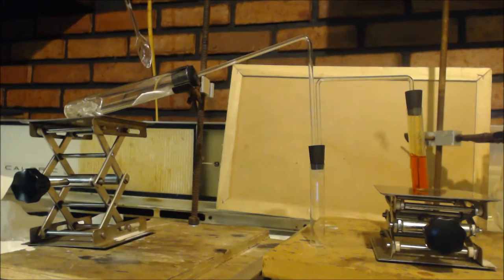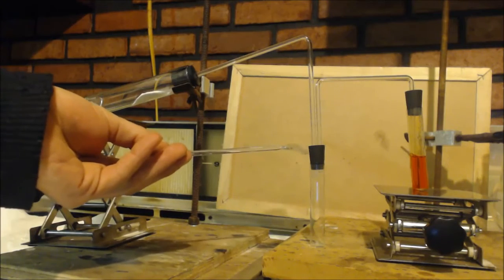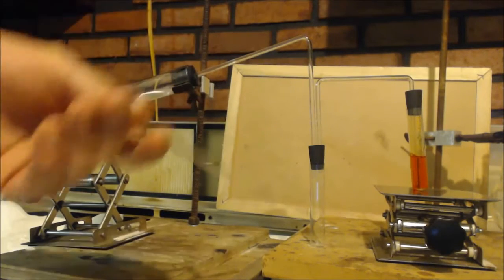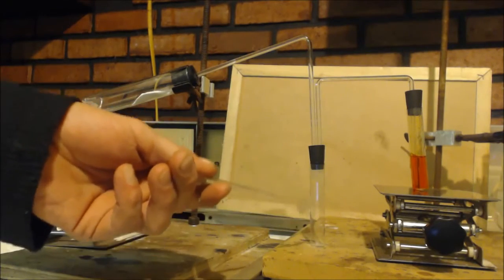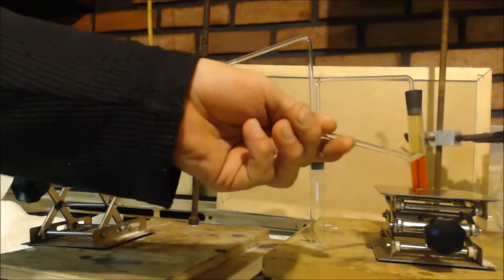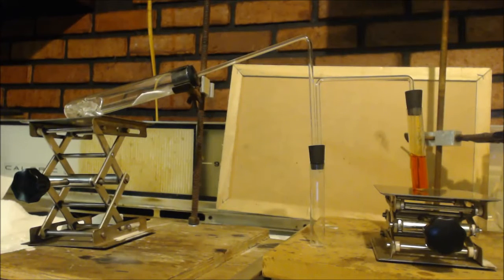There's my dehydrator, the aluminum oxide. It feeds out to an empty container. I don't know if you can see the container. I know you can see the stopper. The empty container is because some ethanol is coming out, liquid ethanol. This will catch it. It'll come down here and condense, and only the ethene can come out this way to the next test tube, which has that bromine water in it. And bromine water, if this goes into that, it will make a halohydrin. It'll decolorize that bromine.